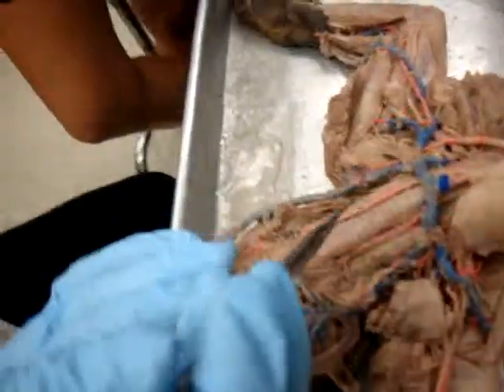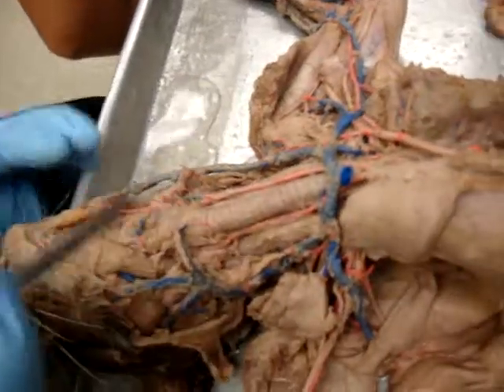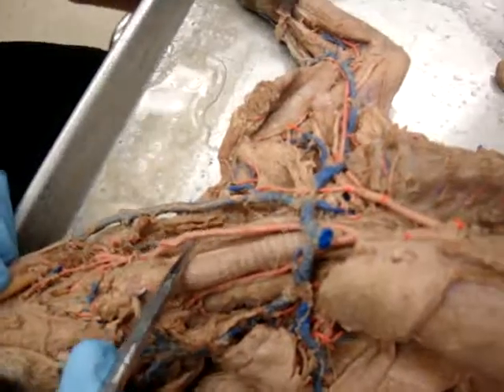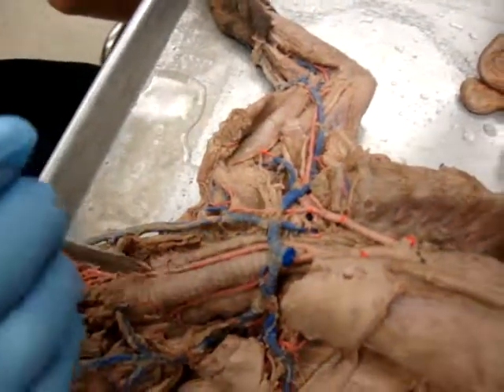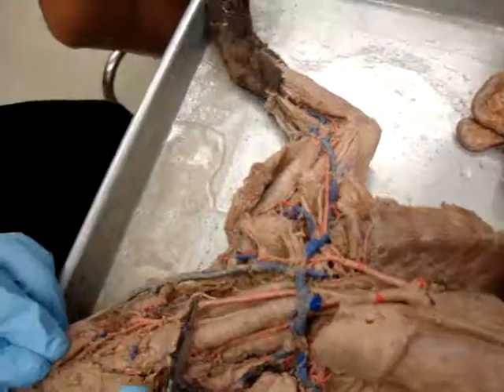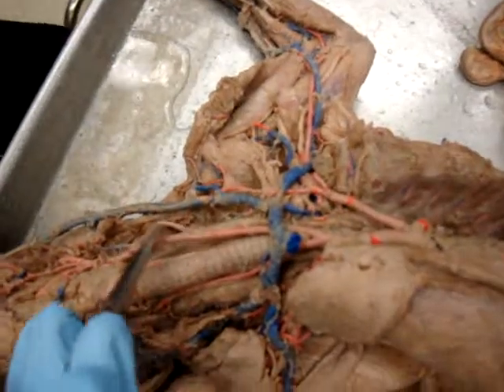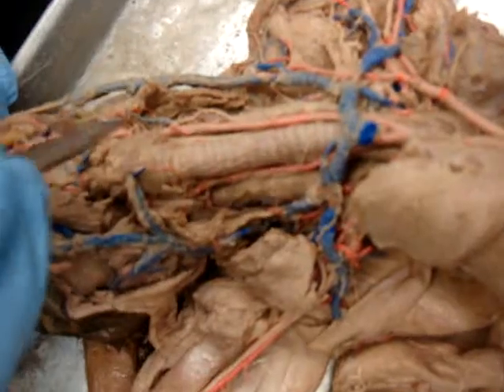Okay, so here are your common carotids. There's left and there's right. Let's look at the left since it's more well cut. So that common carotid, oh, and there's a nerve running right next to it. What nerve runs next to the common carotid? What nerve do you always guess if you're not sure? Vagus. Oh, because it goes to the heart. 5 is thicker, but 10 is bigger.